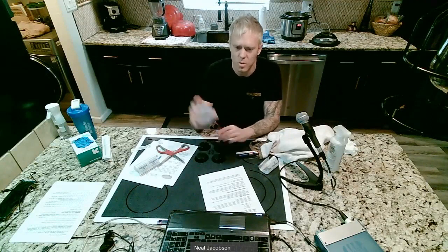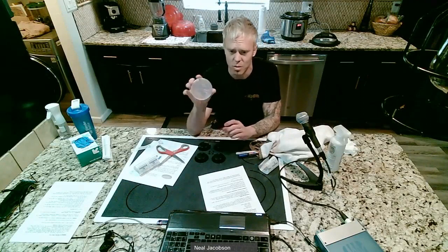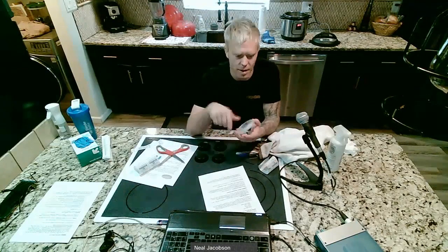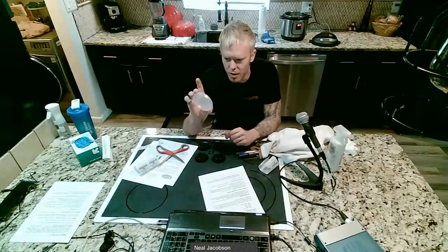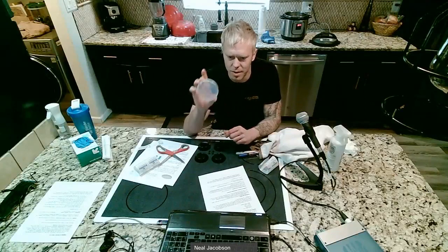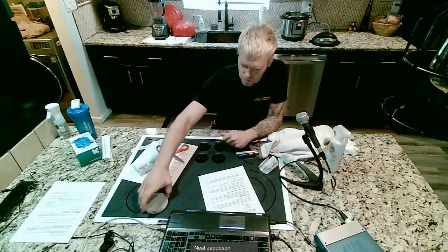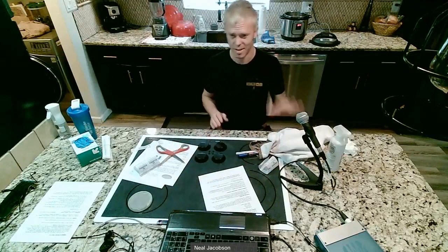And now what we need to do is incubate this for 5 days. We're just going to leave it at room temperature, set it on top of your fridge, right? It's all sealed up. And hopefully we've done a good enough job keeping it clean that we can actually have viable results for our experiment. So that's one petri dish. We got 9 to go.